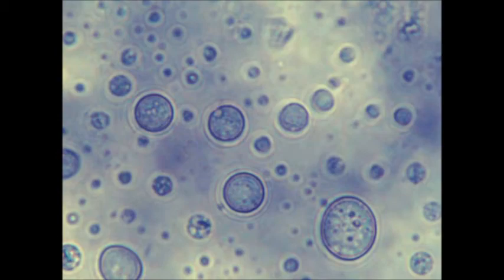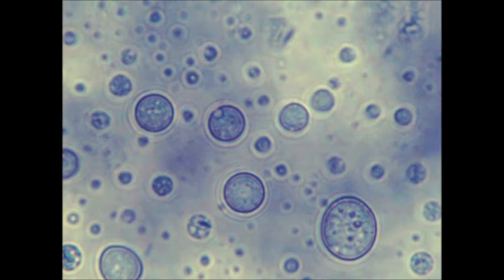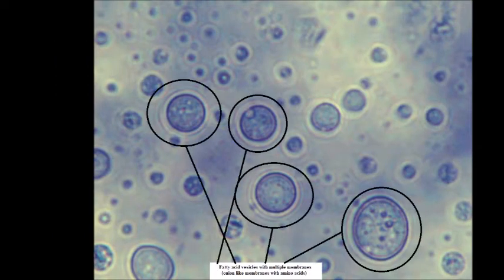In the experimental solution with amino acids pictured here, you can clearly see the multiple layers of membranes. Again, we would expect that these multiple membranes would serve to retain the cell contents against the concentration of solutes in the external environment. And so these vesicles with multiple membranes were likely the precursors to the first living cells.